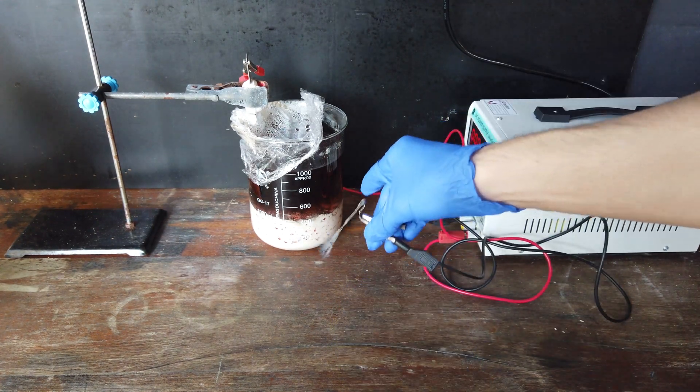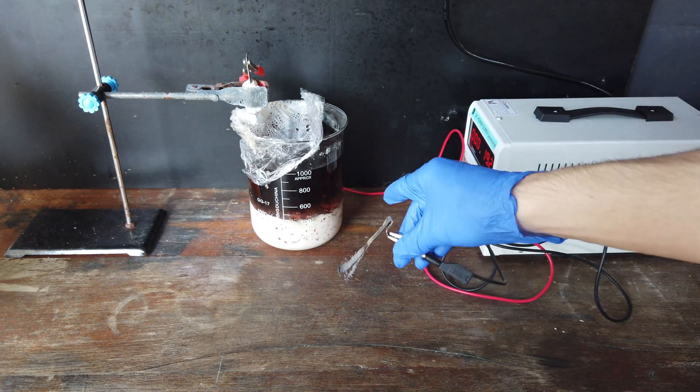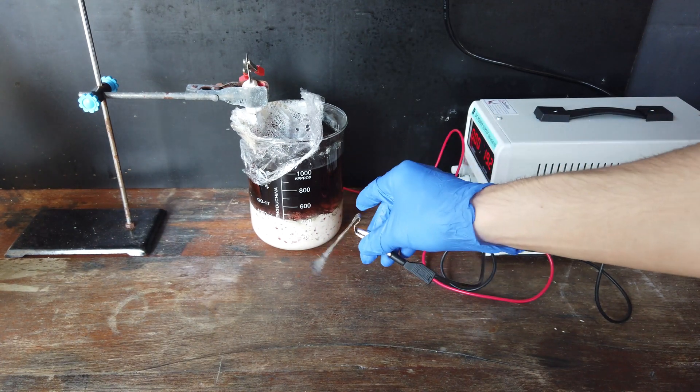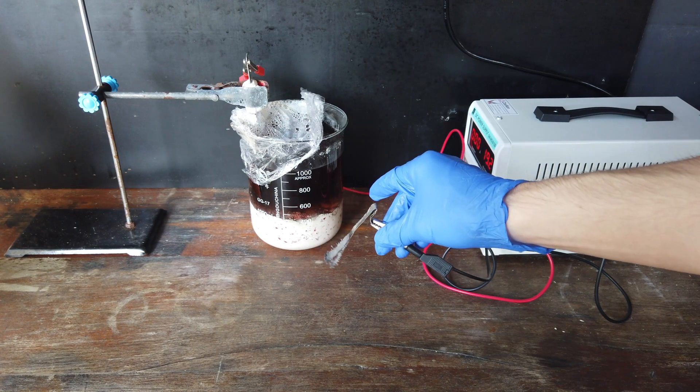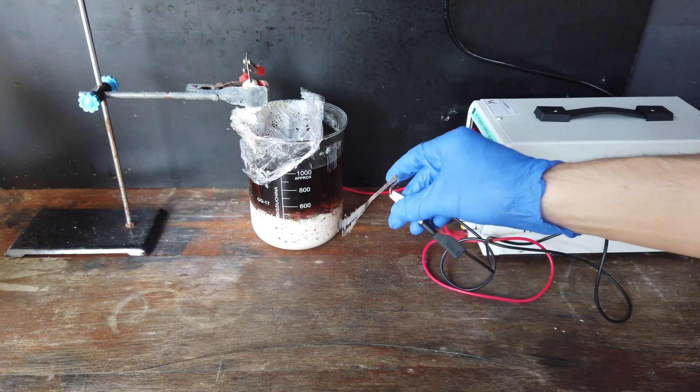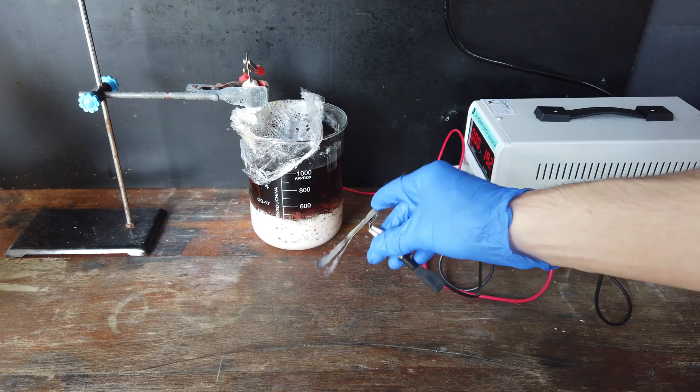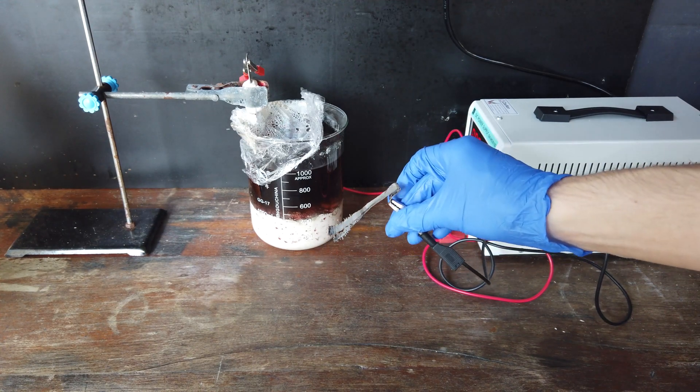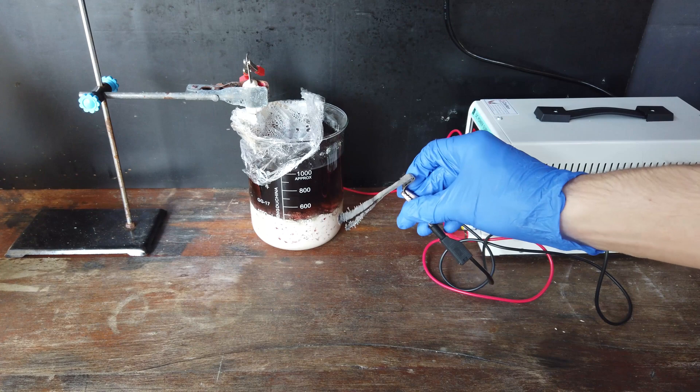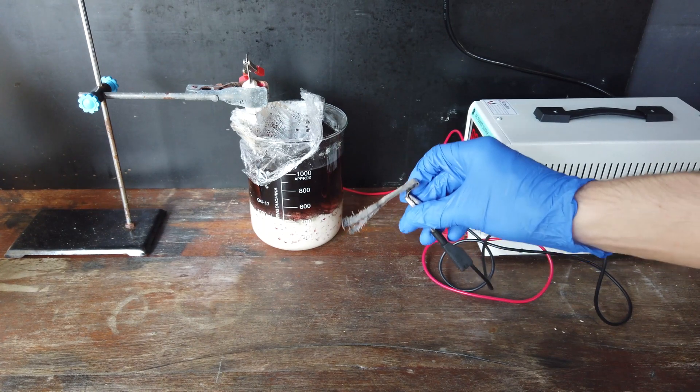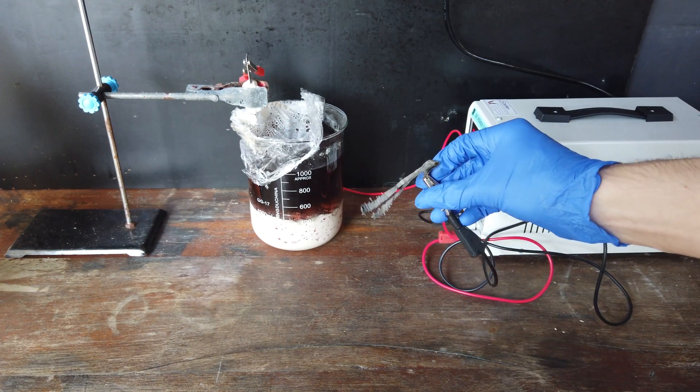A whole lot has actually fallen off the cathode and fallen into the cell. I'm not thinking that is too much of a problem. Because what we can do is, once we're finished, we can fish around with the leftover precipitate with a magnet. And because both cobalt and nickel are ferromagnetic, that should work out really nicely.